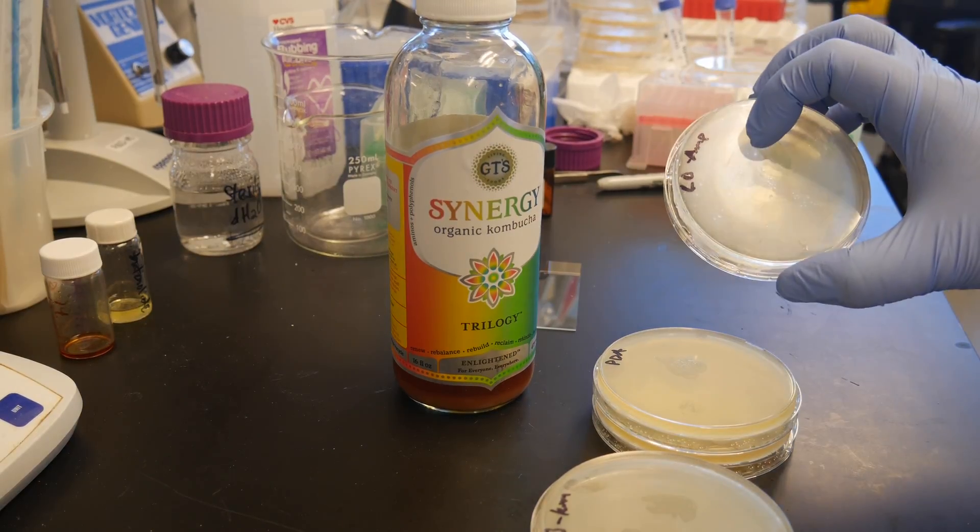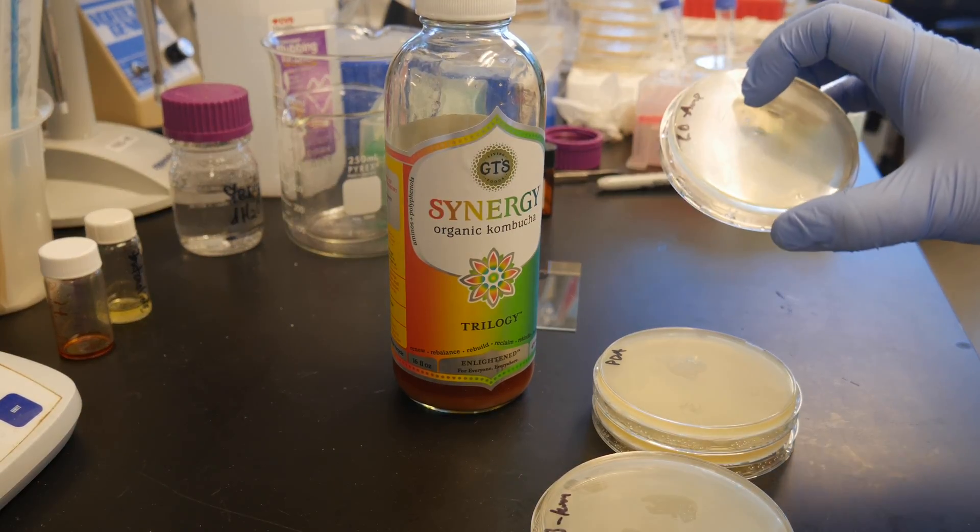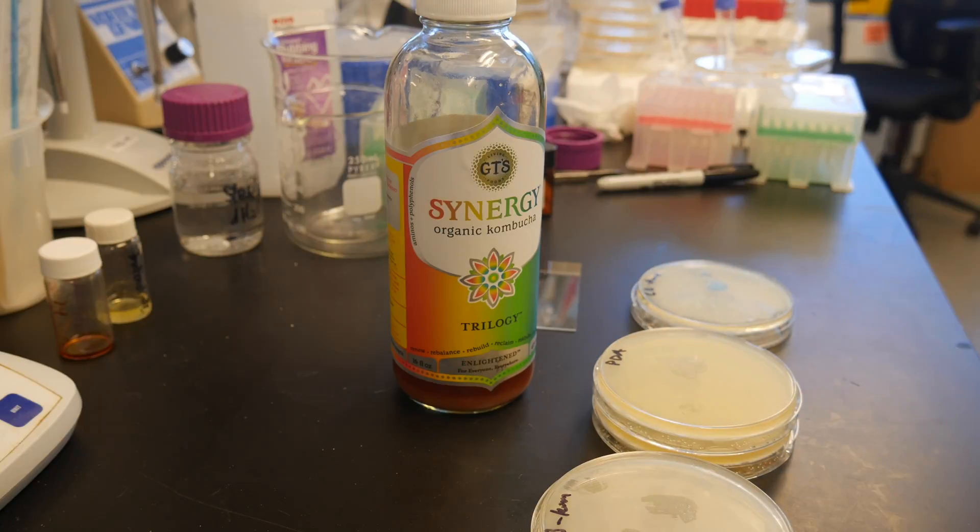And I have another one, LB with ampicillin added, which is an antibiotic. This will theoretically kill the Bacillus and potentially allow some of the yeast to grow, even though yeast doesn't grow too well on LB. I didn't actually make up appropriate media for the selective isolation of these two organisms, or whatever else is living inside, but we'll give it a try.